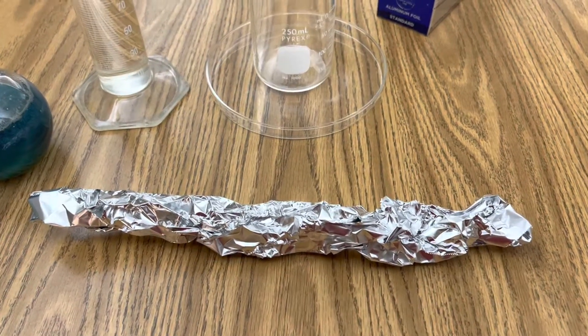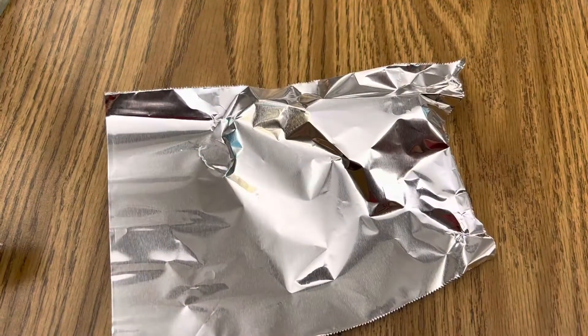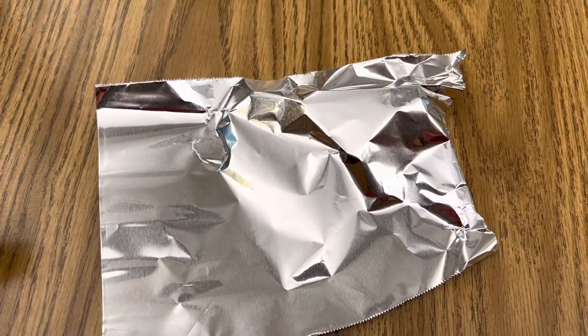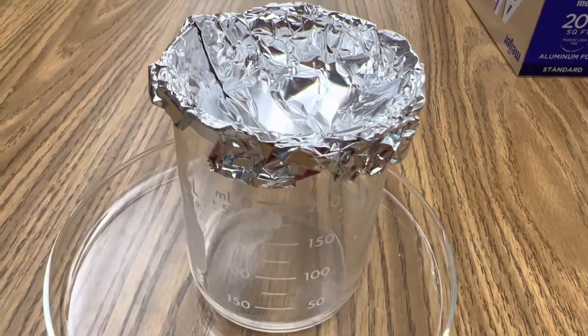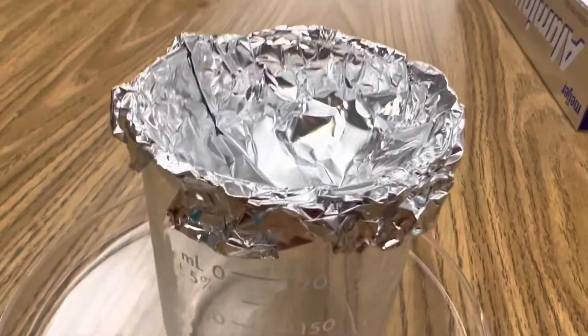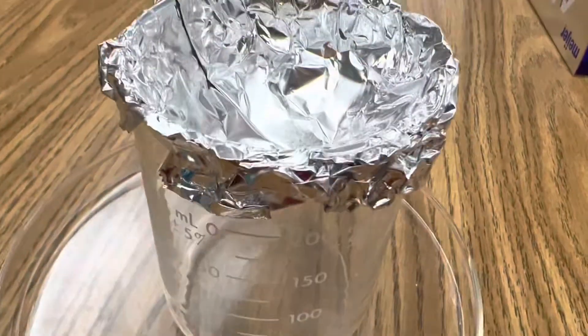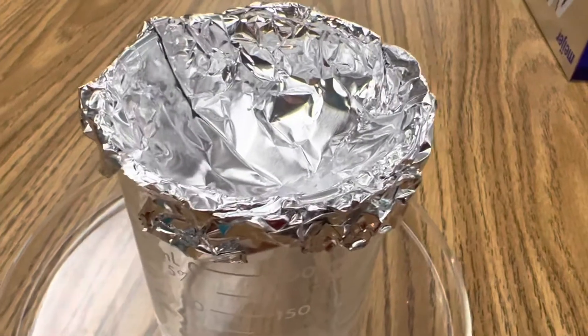Begin by tearing off a piece of your aluminum foil and wadding it up so that you can fit it down the neck of your graduated cylinder. Next, cut a smaller square of aluminum foil to put over your beaker. Place the aluminum foil over the beaker so there's a small indentation where it can hold just a little bit of your solution of copper chloride.